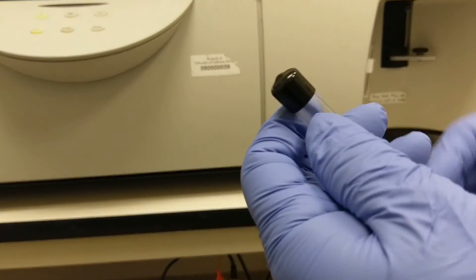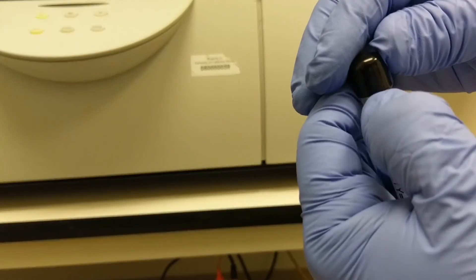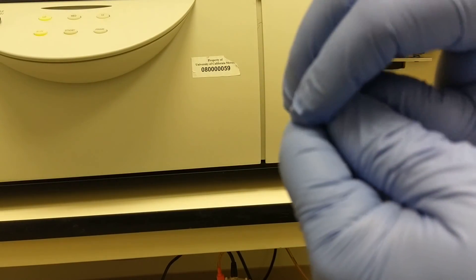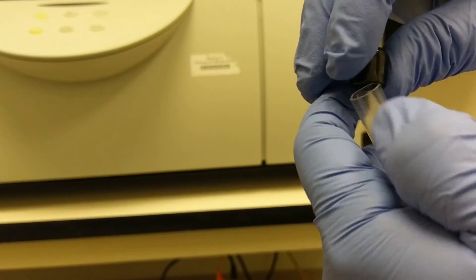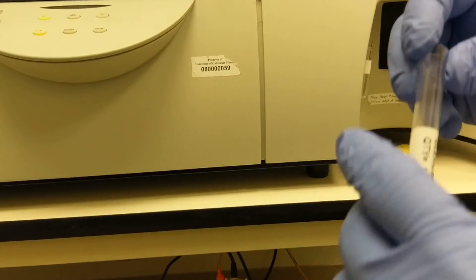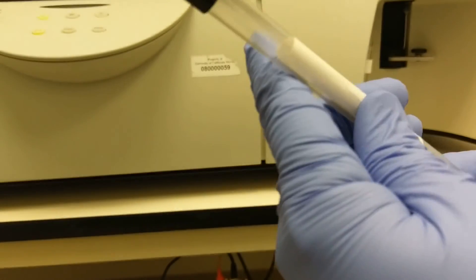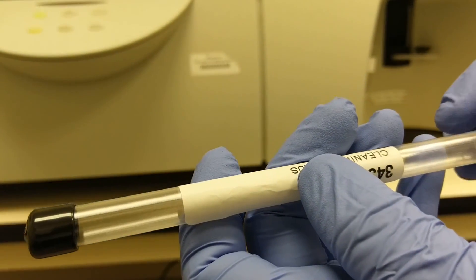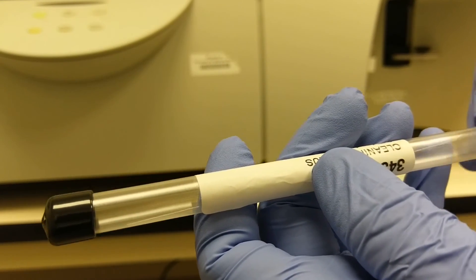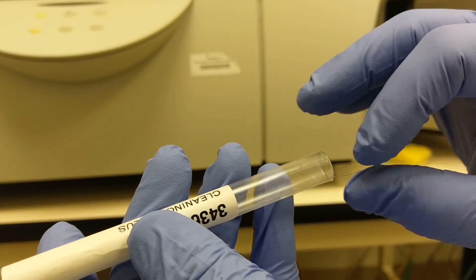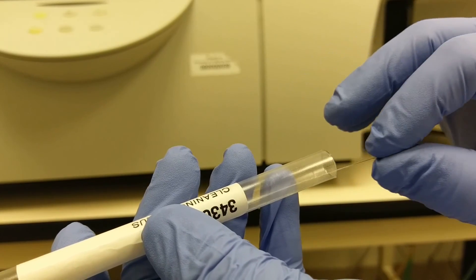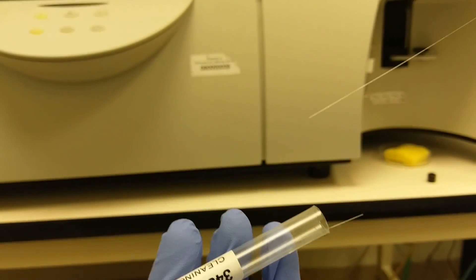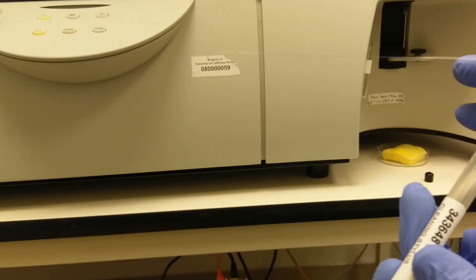These are a real thin wire, probably about 100 microns I would guess in size, in thickness. And it's a long wire that will go all the way into the sip. It almost looks like there's nothing in this holder. But once you open the cap, you'll see a really thin wire.